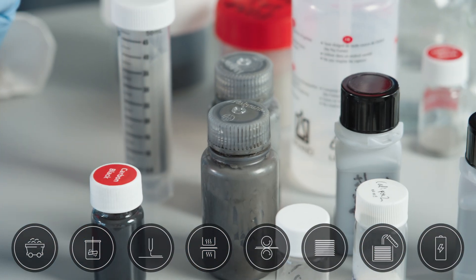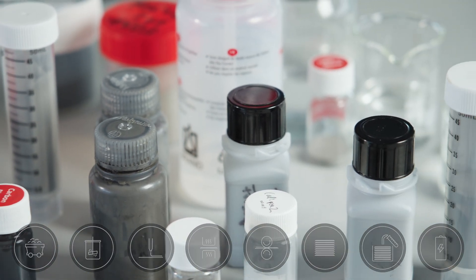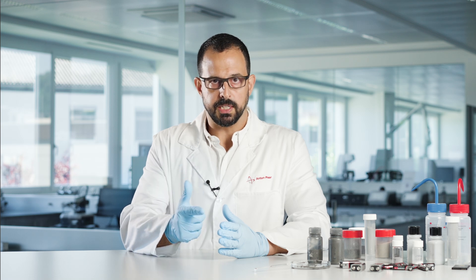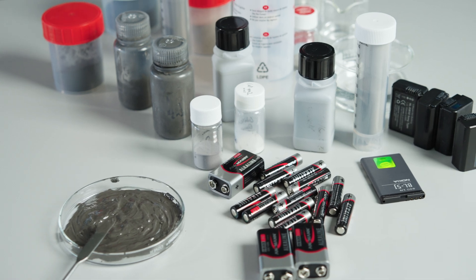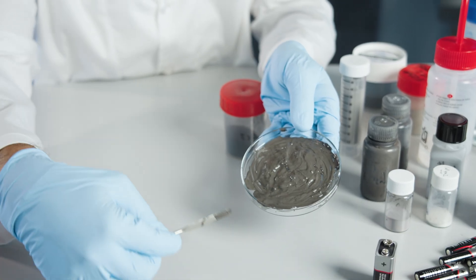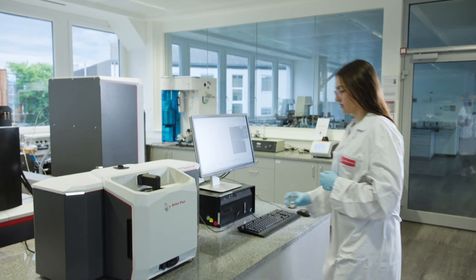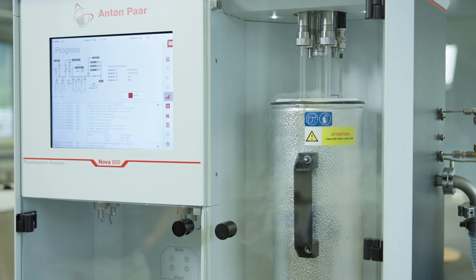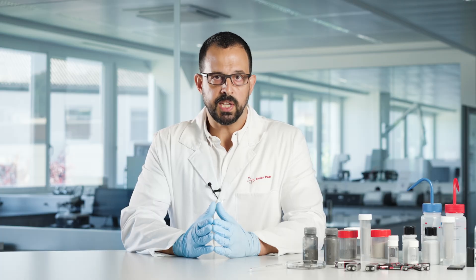Throughout the manufacturing process, the proper characterization of battery materials is crucial. There are two types of characterization — physical and chemical characterization — and they are both complementary to each other. In this video series, we will focus on the physical properties and the techniques used to accurately measure them, since these characteristics will have an immediate effect on the energy density, cycle life, safety, and overall performance of the battery.